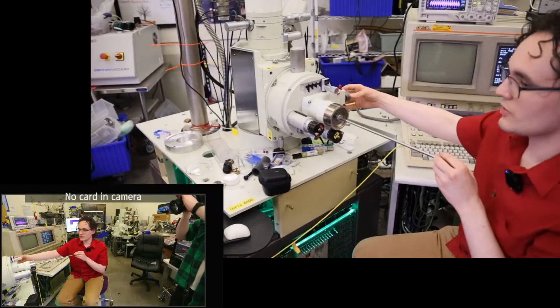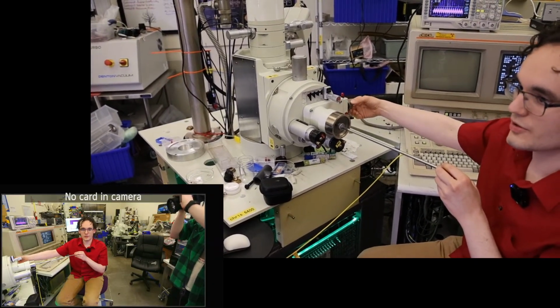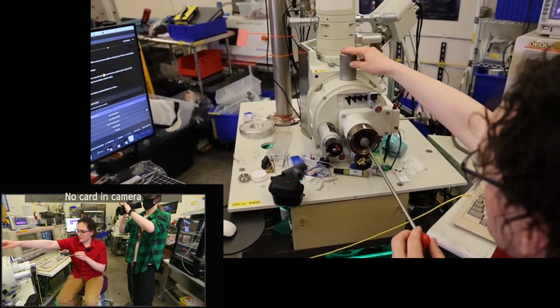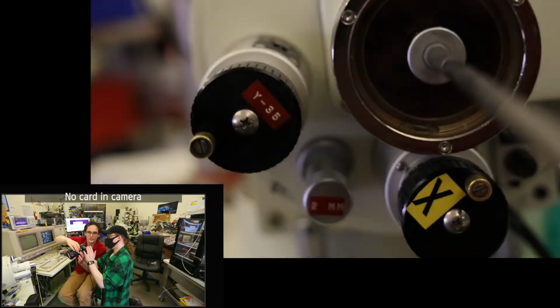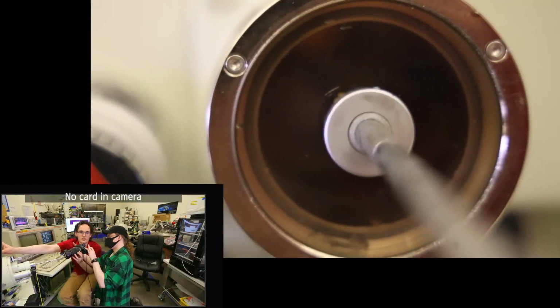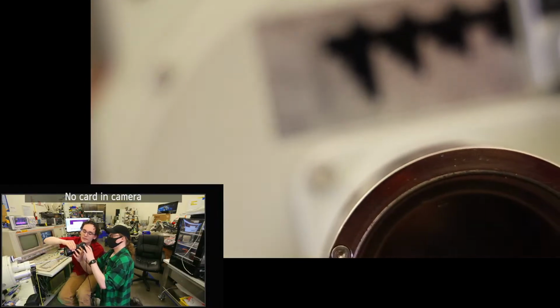Okay, so our load lock cycle is complete. We can roll the knob 90 degrees back, so you go from there to rolling it towards you, and then you can open the door. Do you want to see if you can point the camera down here? Let's zoom in as far as we can. And then I'm going to lower the stage down, and we're going to manual focus because it's not going to want to focus back there.